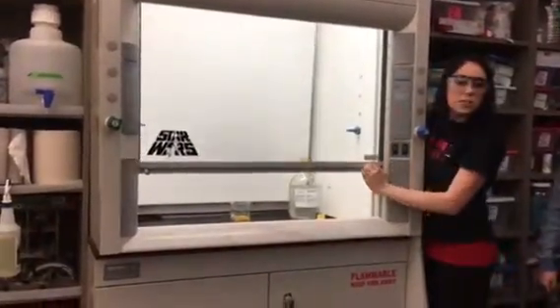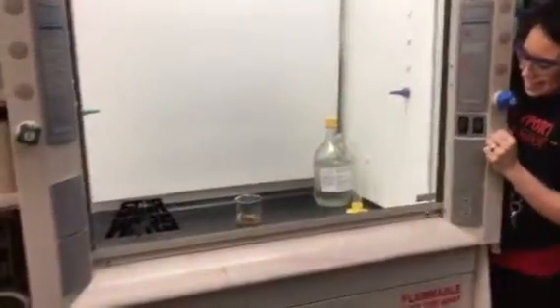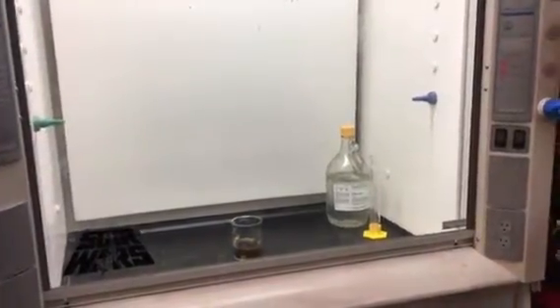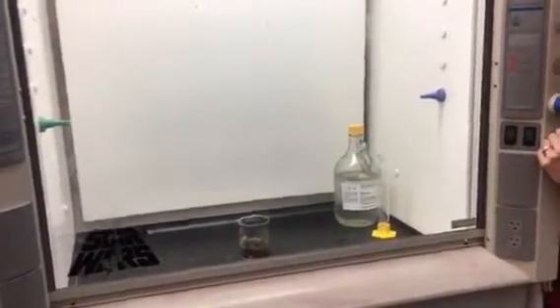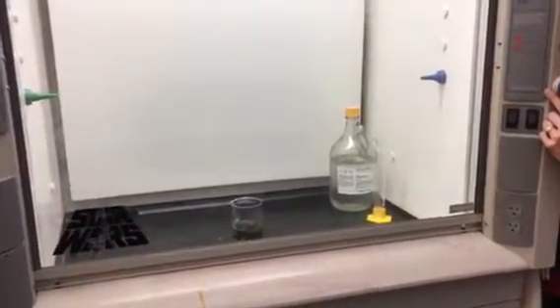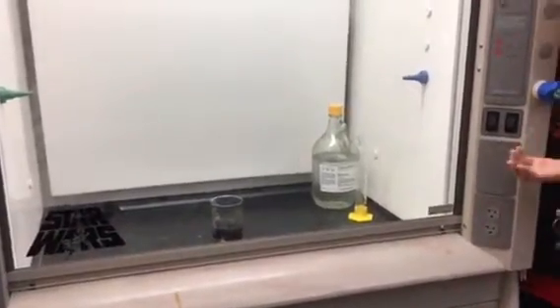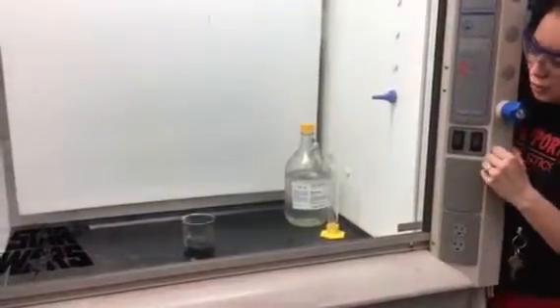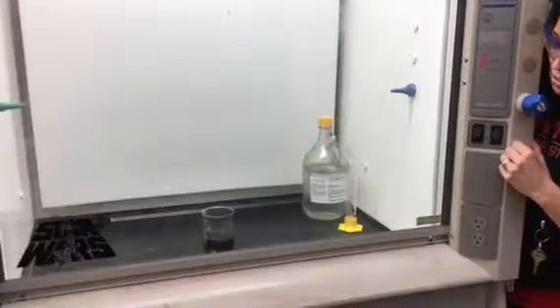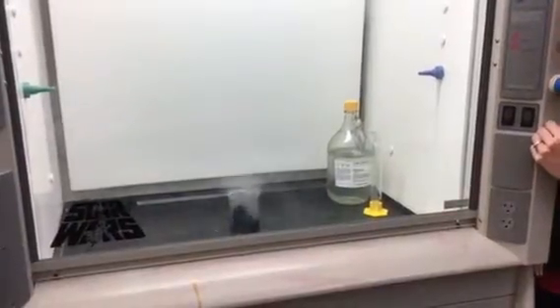I'm going to shut this — you can still hopefully see it through the... There we go. Oh yeah, this is the one I'm looking for. Takes a little while. It's so creepy. Make sure you can see the beaker — get down close, there's room in the front if you want to squat down. It's just about to start going crazy. All we did was add acid to sugar here — remember that. White stuff and clear stuff. Chemistry is crazy. Here it goes — it's coming alive.